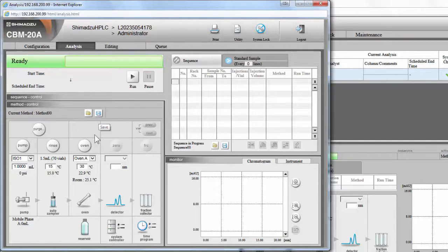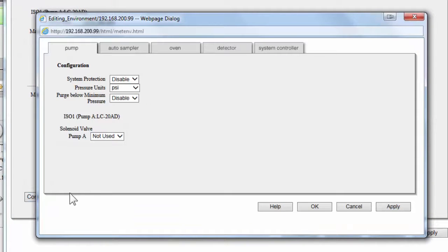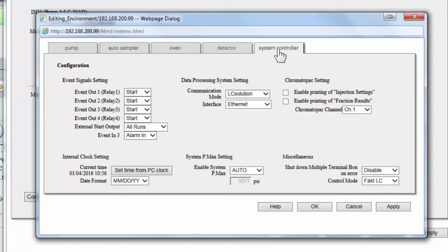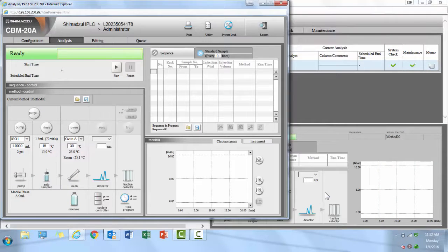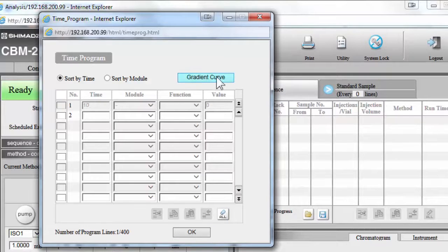On the bottom of the page, you will see a System Controller button. Just like your system parameters in Lab Solution software, this allows you to set specific method criteria for each module in your HPLC system. If you click on the Configuration button at the bottom, this will allow you to access specific configuration settings for each module. The Time Program button allows you to program time-specific changes to your chromatography, such as mobile phase concentration.